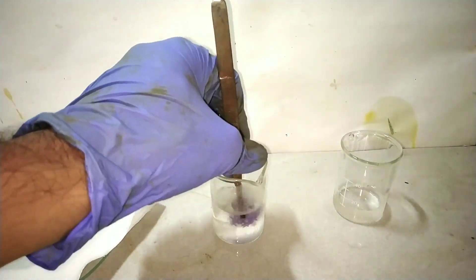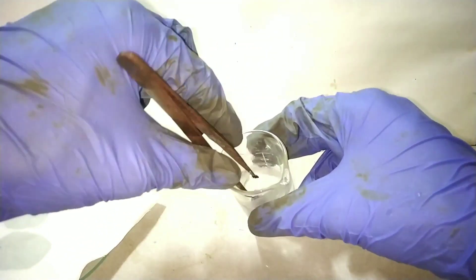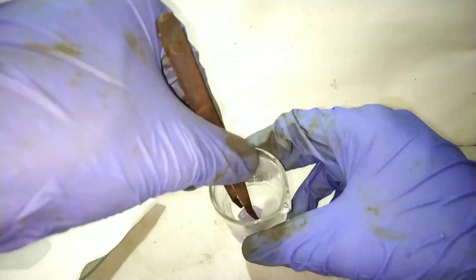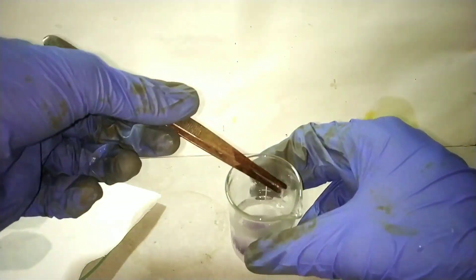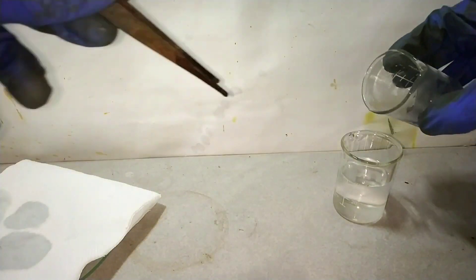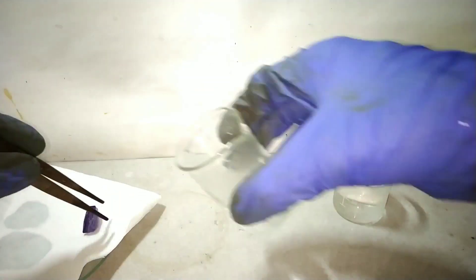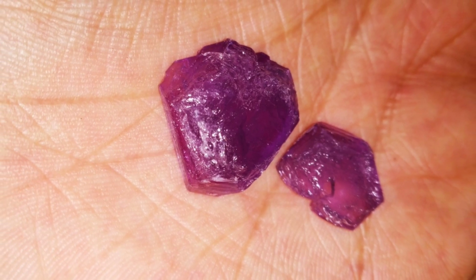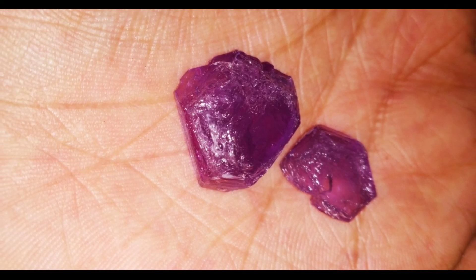After taking the crystals out from the beaker, I washed them in an ice cold water and alcohol mixture. After cleaning and drying them on tissue paper, I painted them with transparent nail polish, and now they are safe to handle.